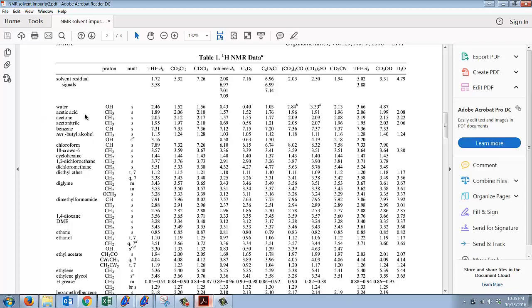So you're going to be a little smart. What solvent did you use in that lab? If you know that you used, for instance, diethyl ether, then the first thing you should do is make sure you know where diethyl ether is. If you don't get rid of all the diethyl ether from your reaction, you may actually see the peak still in your sample for the NMR. So one of the things you want to do is have this table handy.